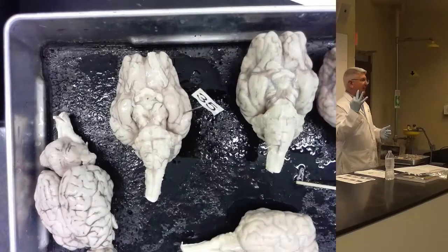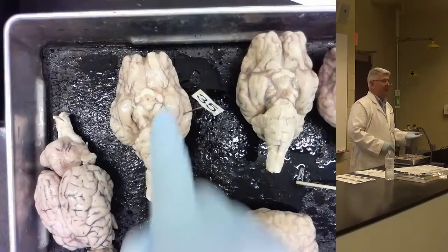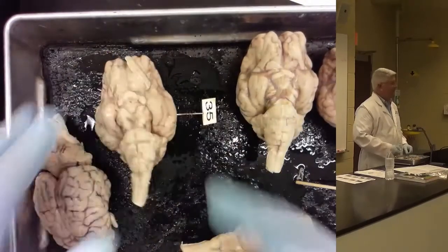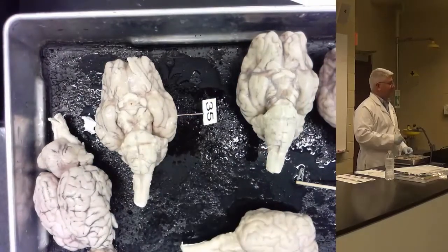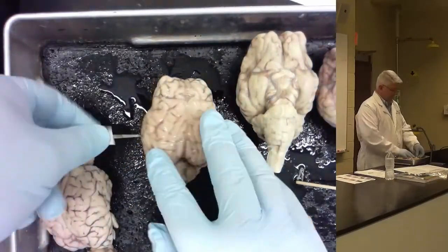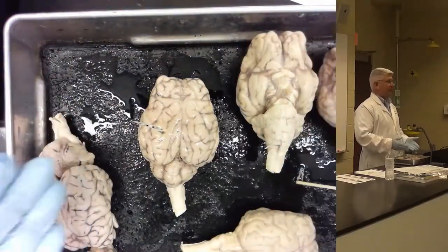The rhinal fissure. So in the posterior part of the brain, you have so far 3 sulci or fissures that you have to identify. The rhinal fissure can only be seen from the bottom of the brain and is right next to the hippocampus. The lateral fissure can be seen from the bottom or the top and is lateralmost. It's not going to be near the hippocampus. It's going to be on the lateral part. And on top, same thing. And then the suprasylvian fissure, which is only going to be on the top of the brain, and it's going to be parallel to the longitudinal fissure.